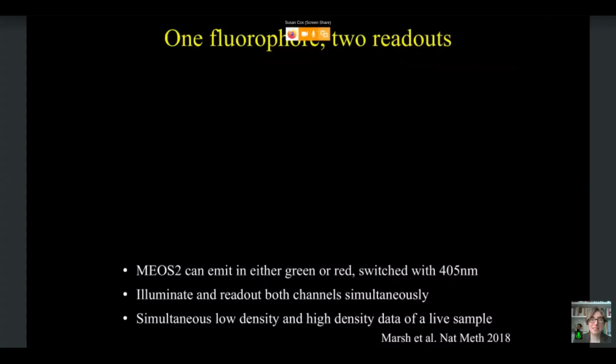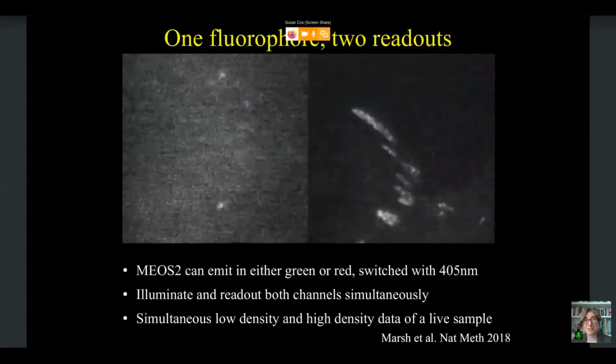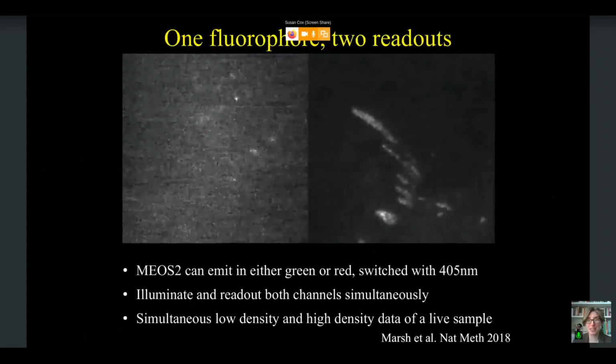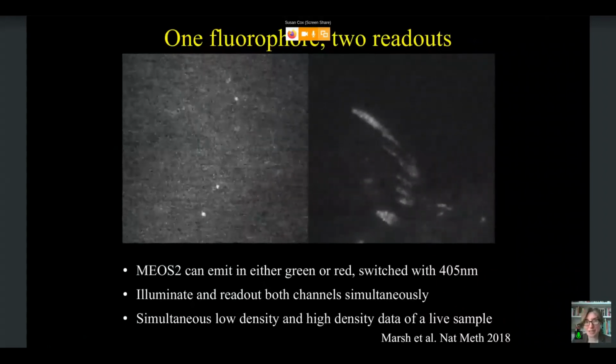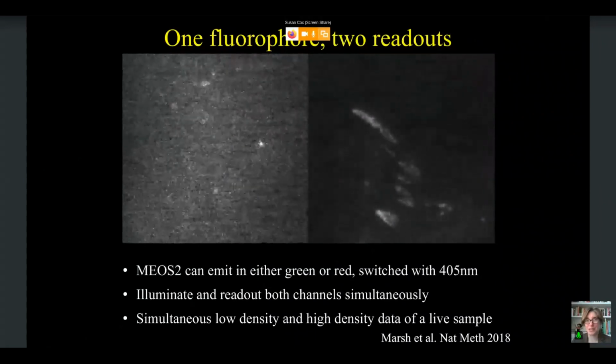We also did vinculin and focal adhesions, but focal adhesions, of course, being 2D, are much, much more challenging. And for various reasons, we only had MEOS 2 for this one at that point in time, and it was not as high performance.